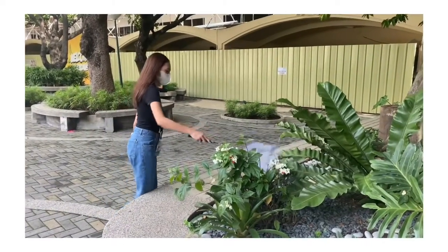There were three collection methods used for this activity. First is with the help of a sweeping net for collection of insects. The vegetation around the nursing building was swept with the net, and the larger insects collected were placed inside a killing jar, with ethanol as the killing agent.